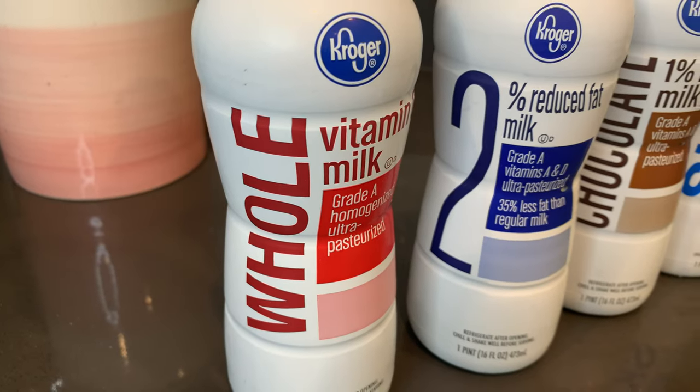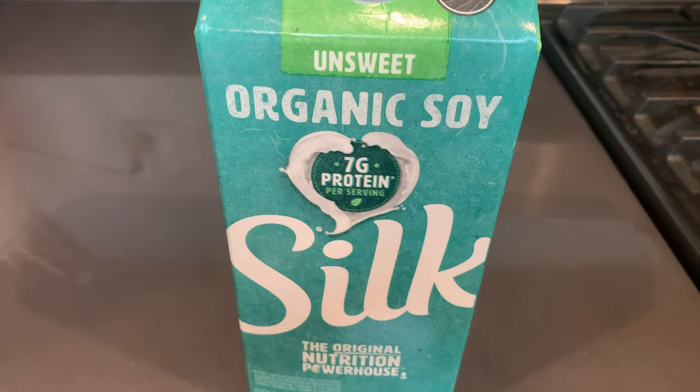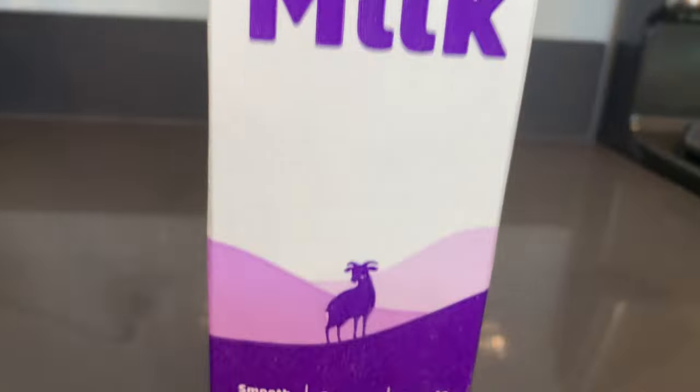Today we're going to be looking at different kinds of milk and milk substitutes under the microscope. Now, I've never done this before, so I thought it'd be fun to get as many varieties as I could of different kinds of milks. So I have four different kinds of cow's milk, I have some soy milk, I have some goat's milk, and we even have human milk.